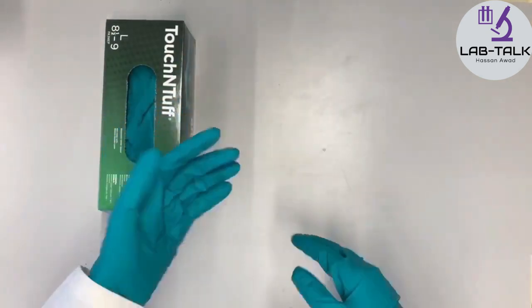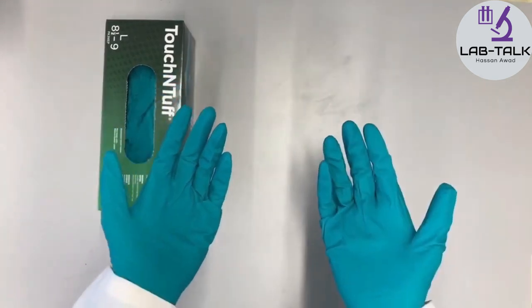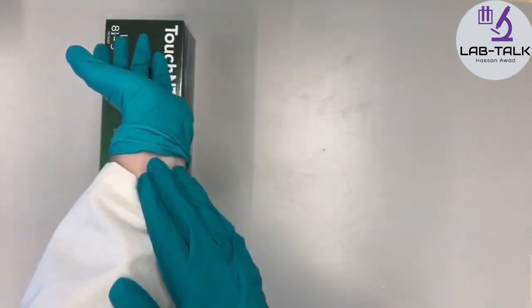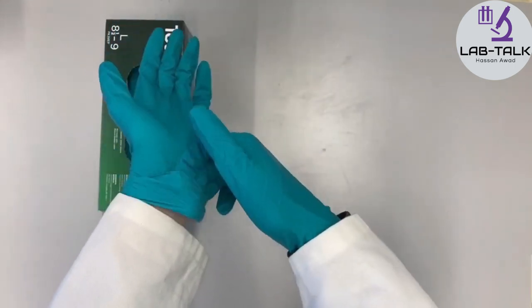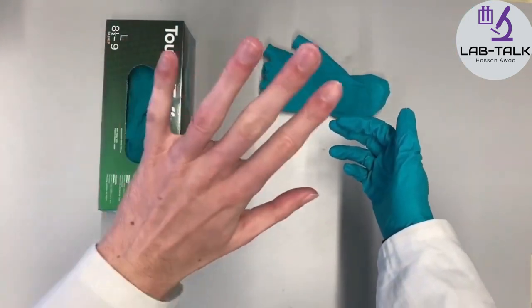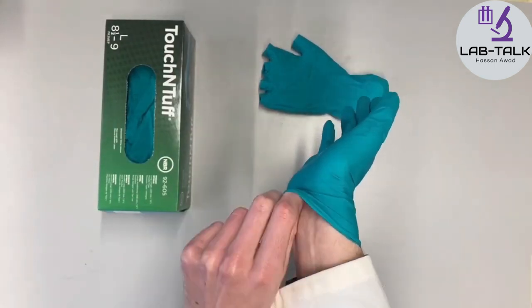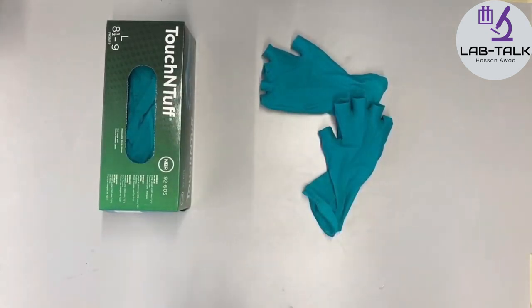When you're done working with the chemical, or when you've spilled some chemicals on your gloves, you want to take them off. But the gloves are there to protect your skin, so don't touch your skin with your gloves and rub the chemical all over your arm. When you take them off, put your finger underneath the glove and pull it off. Now you have one clean hand and one gloved hand. Put your clean hand underneath the other glove — because the inside of the glove should be clean — and pull it off. Then throw them away in a solid waste bin.